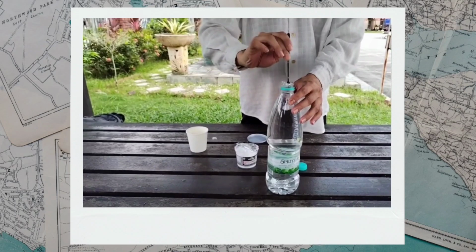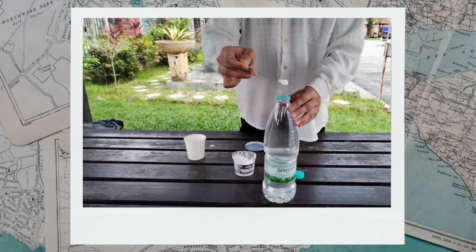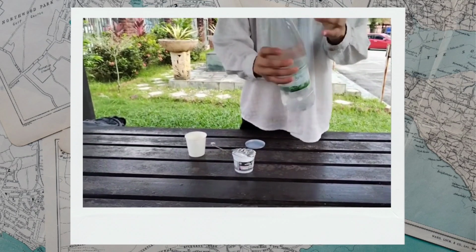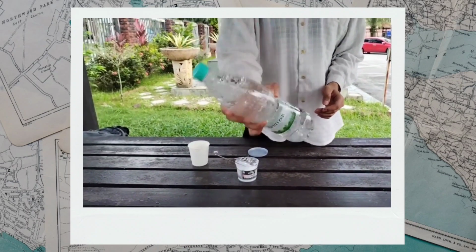Make a 0.2% sodium bicarbonate buffer by dissolving 2 grams of baking soda in 1 liter of water. You will need approximately 100 milliliters per setup, half to make the gel and half to run your samples.